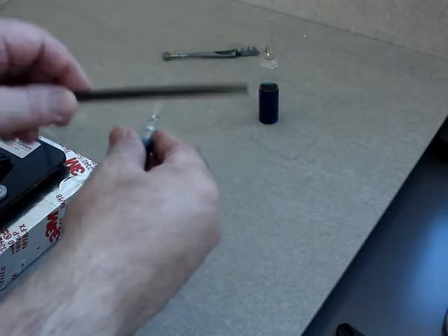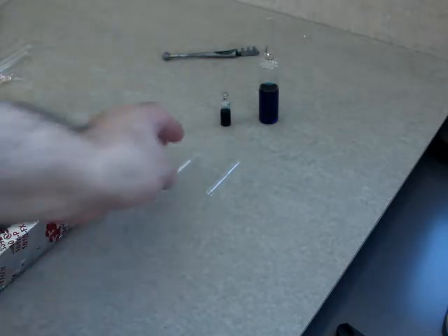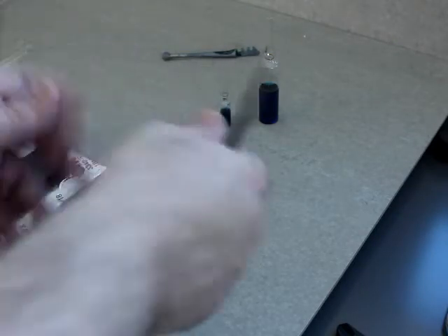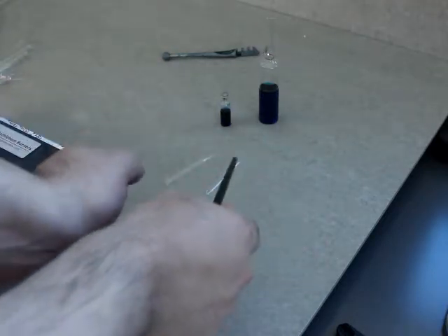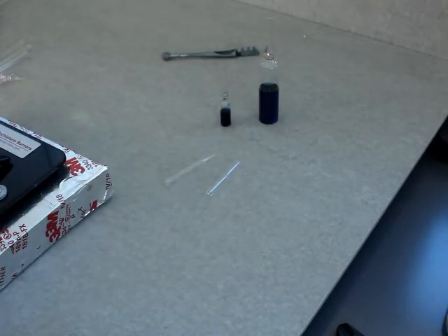To prepare myself for scoring and snapping the ampule, I must have sacrificed a dozen, maybe 20 of these disposable pipettes doing the scoring and snapping method, until I got the mechanics right with my hands where I could do it and I didn't have to think about it. This is the kind of physical technique that once you've got the mechanics down and you feel good about it, you can do it no problem. If you overthink it, if you hesitate, it'll be disastrous.